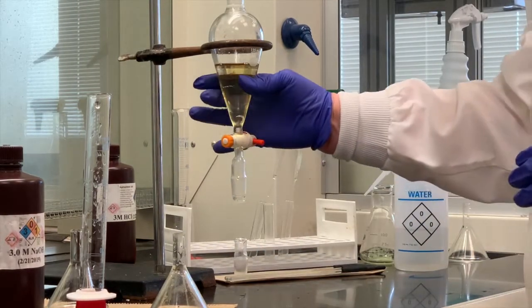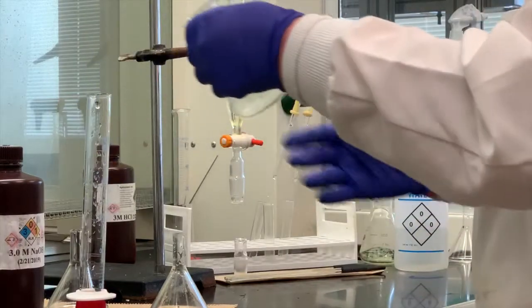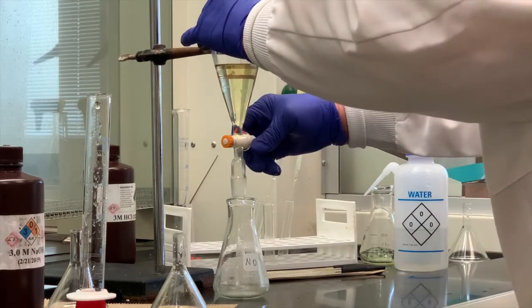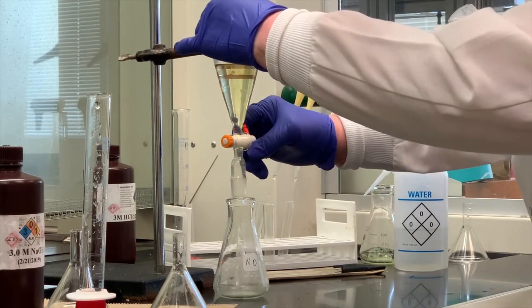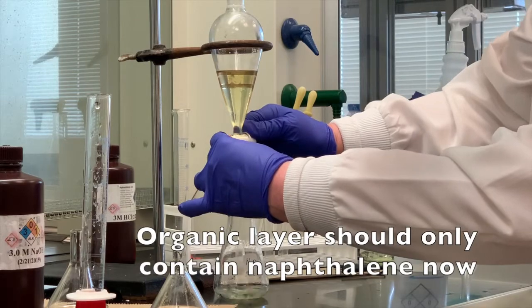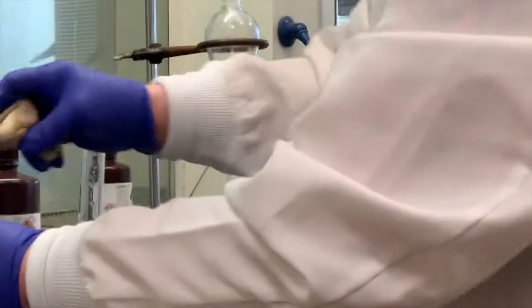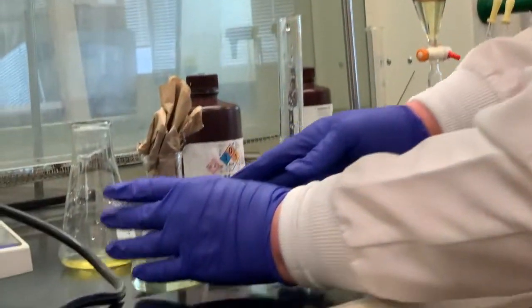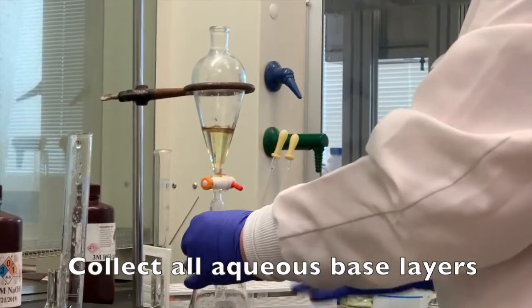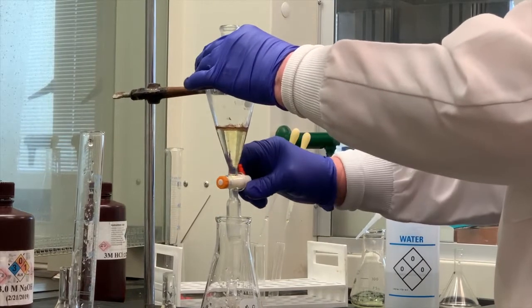Now remember, if the organic was the bottom layer in the first sodium hydroxide wash, it's going to be the bottom of the second one. Here's my neutral organic. Now I can say with a fair amount of confidence that this bottom layer hopefully contains only the naphthalene. It should contain the compound that was neutral at the very beginning. Stopper the neutral organic. We're not done with that yet. We're going to come back and use that in a second. But now what I want to do is collect all my aqueous base layers. So remember, the top layer is our aqueous base. We're collecting it into the first material that we collected as aqueous base.